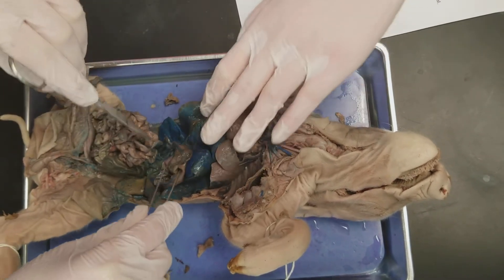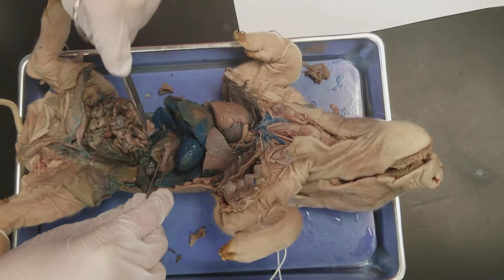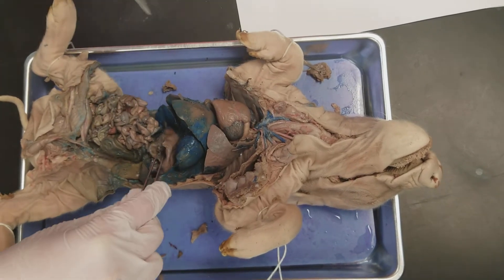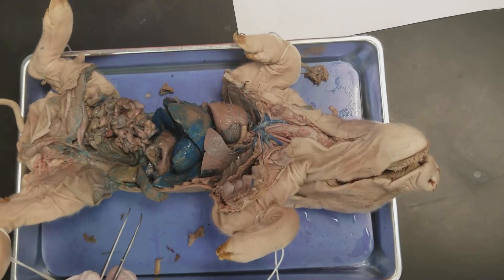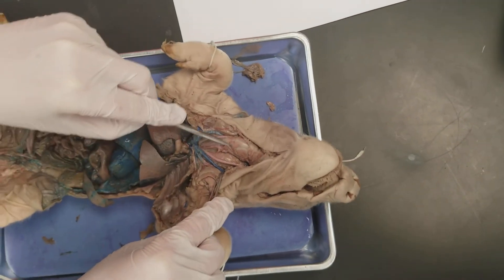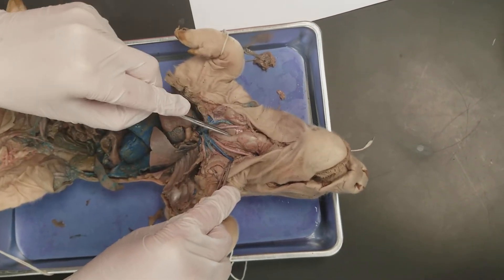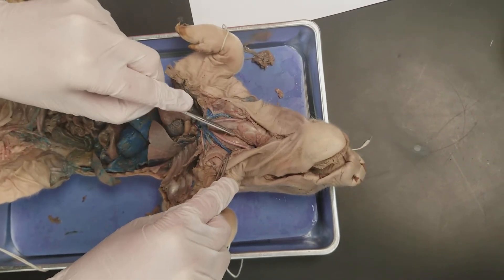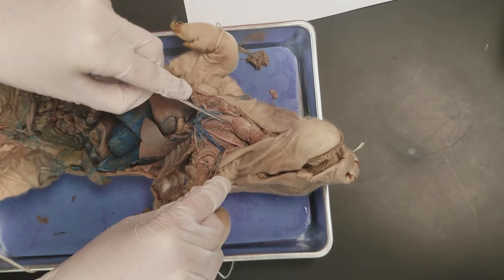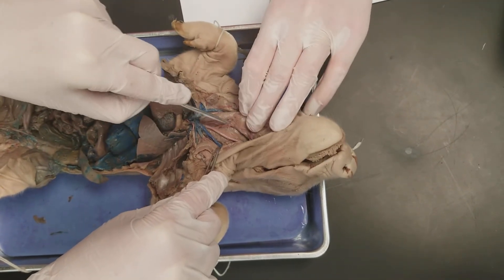The stomach is this entire structure here — we cut ours open to see the inside, but this entire structure is the stomach. The esophagus is not very visible, but it's under the trachea. This is the trachea, and the esophagus is back behind it — you can sort of see it right there.